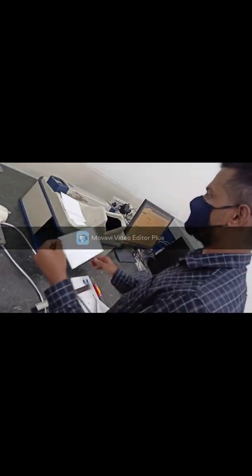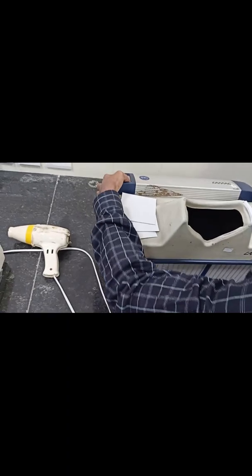Now we will see the bands formed in this plate. We will see it inside the 366 nanometer UV lamp. So you have to switch on this UV lamp. Now you can see the bands are formed. The first 6 are from benzophenone, the next 6 are from benzhydrol, and the last 3 are from samples.